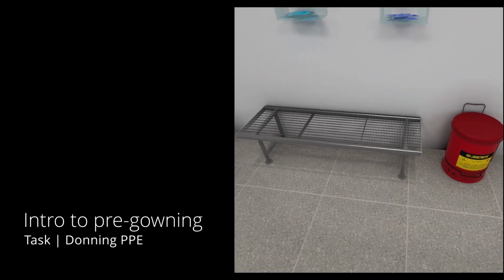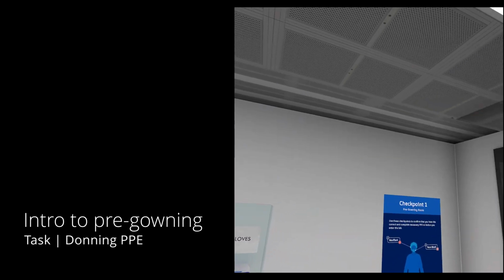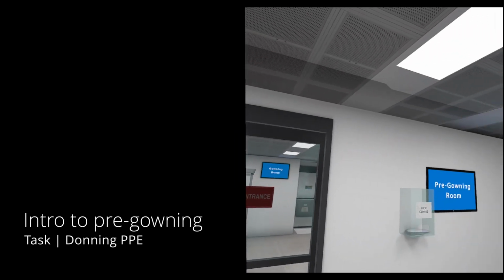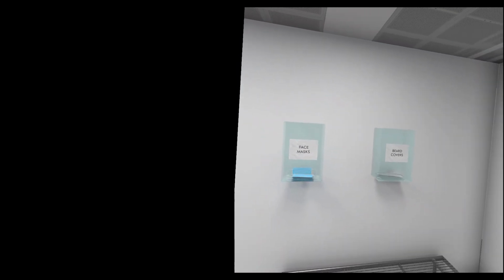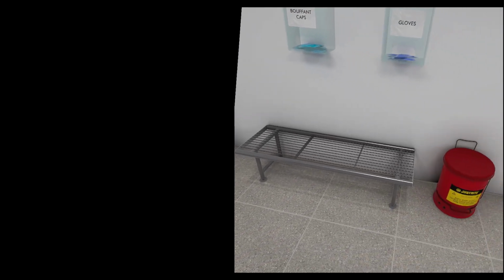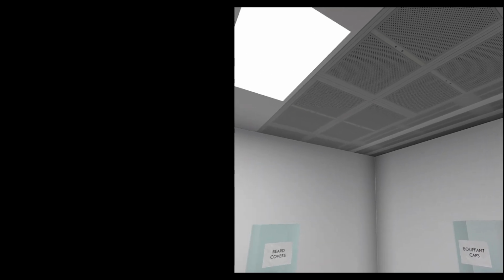Take a look around. You're currently standing inside of the pre-gowning room of the clean room. In this scenario, you are going to practice donning and doffing your personal protection equipment, or PPE, as well as cleaning up a small spill at the wet bench.